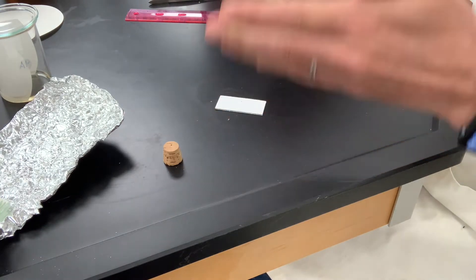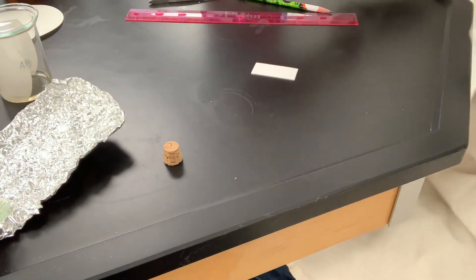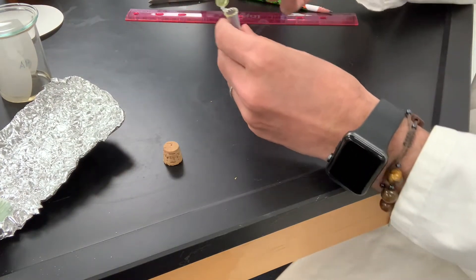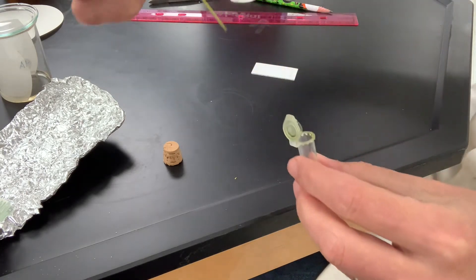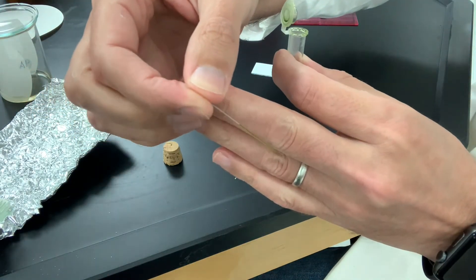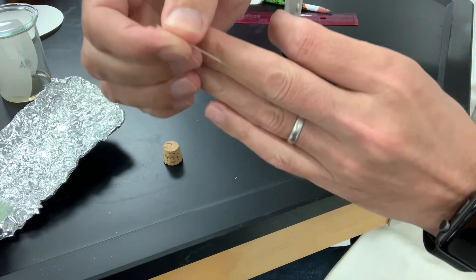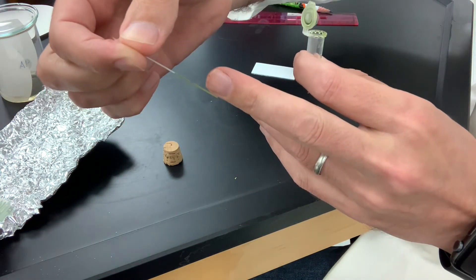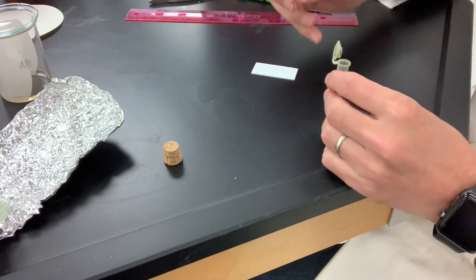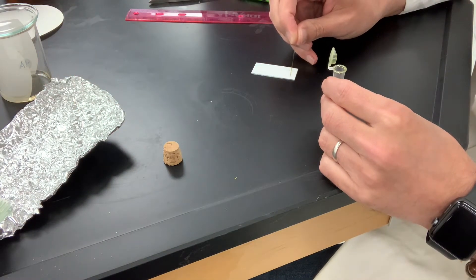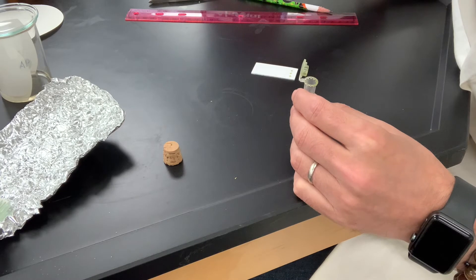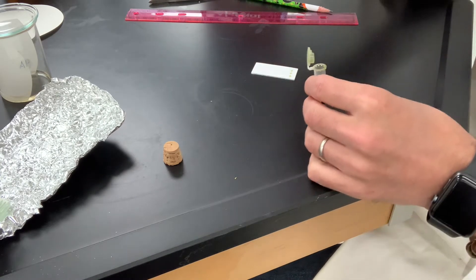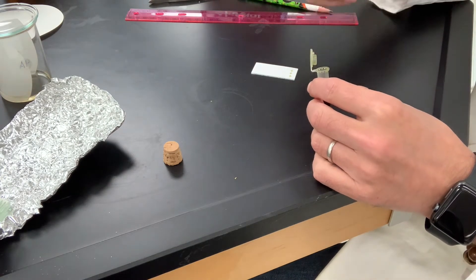So one spot, then three spots, then five spots from left to right. As you can see on the research paper, the values of the RFs did vary a little bit. A little bit of liquid has gone up the tube. So we want the spots to be small. About 10 seconds in between applications here.